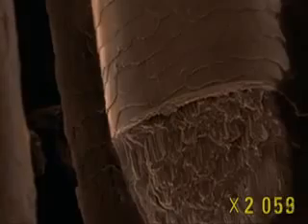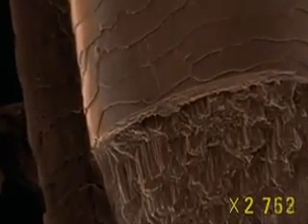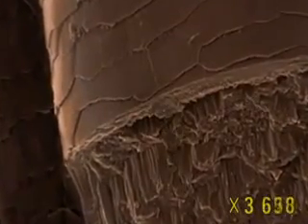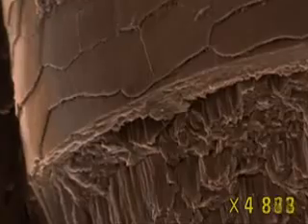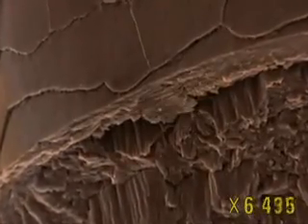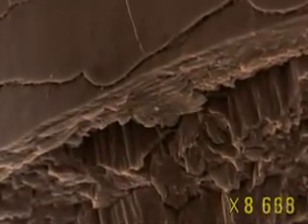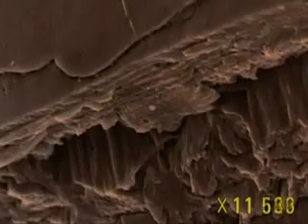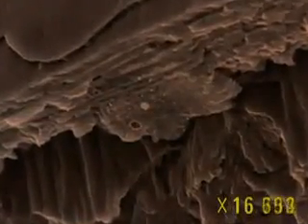Under this protective coating, we can see a rough interior. We have now reached the heart of the hair. The long shapes placed side by side are made up of keratin. Every cell contains several of these keratin tubes. The black spot is a pigment called melanin. Melanin is responsible for the colour of hair.